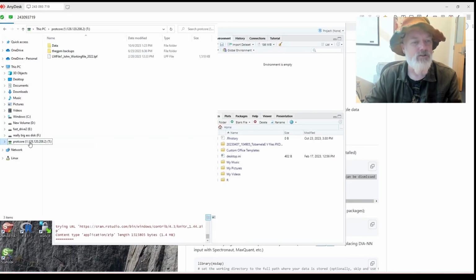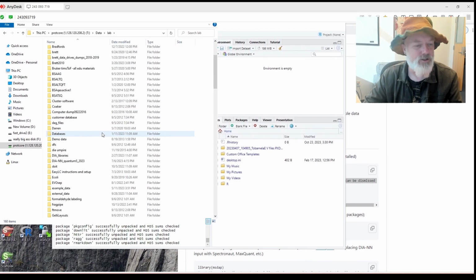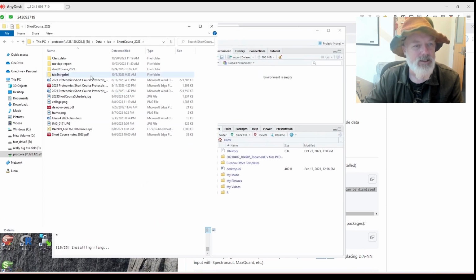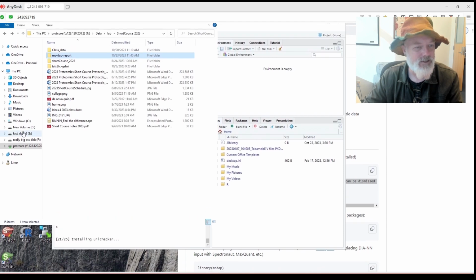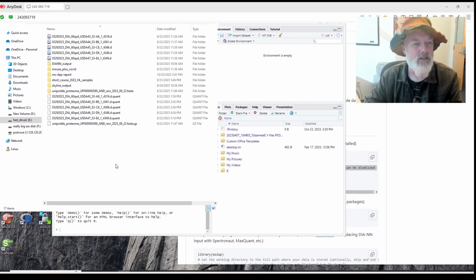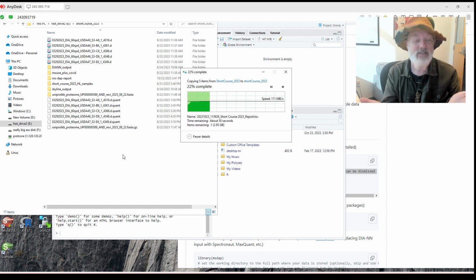What we're going to do is I have some data I generated from this year's short course. In the short course this year we gave everybody samples, and I already exported it, but I'll explain how to do this in a minute. But right now we're just going to copy it over, and we'll call it short course. We'll put it here. So basically we had 36 people this year with various levels of proteomics experience, some with a lot, some with none.